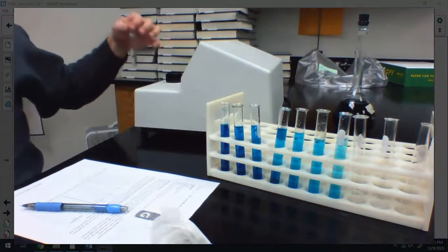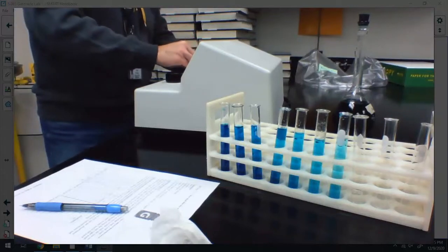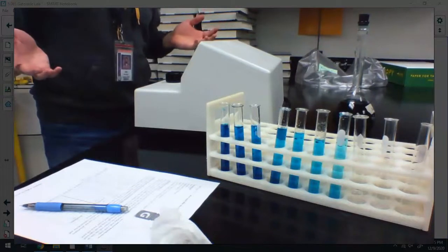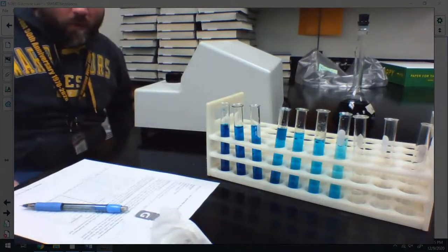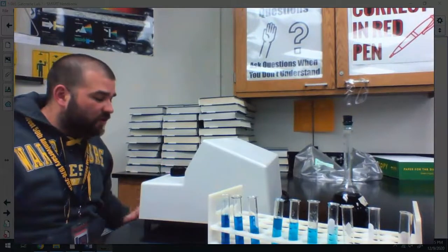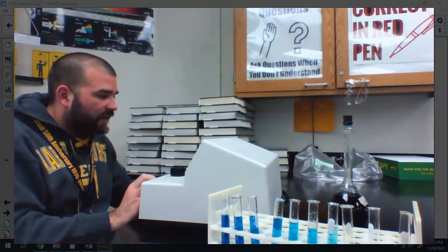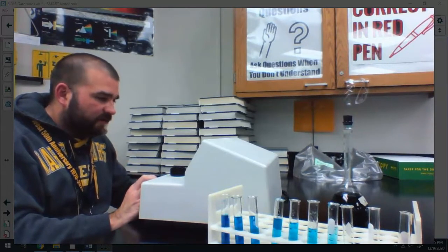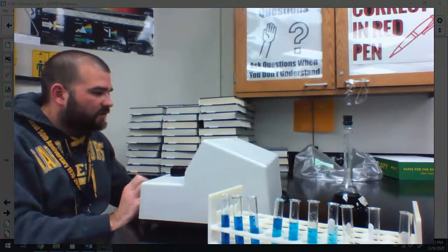Now I'm going to come over here and put this into the instrument because I need to zero it. Okay, now there's no blue dye in water, right? That makes sense. So when I have pure water in there, I want my instrument to read 0, right? There's no blue dye. So I've got to mess with this a little bit, and I'm going to change the dials until I get to 0. Okay, this is a finicky little thing, so I got to be a little careful here, and I'll show you when I'm all done that we got it to 0. All right, sweet.